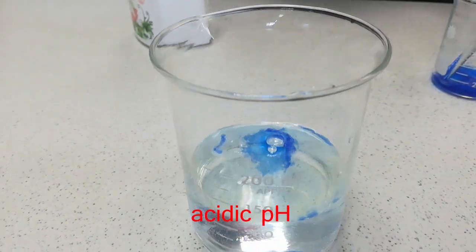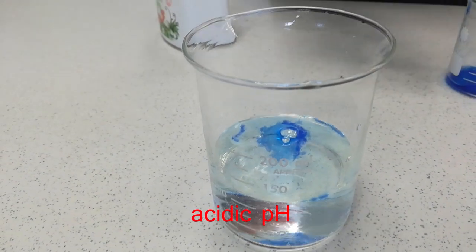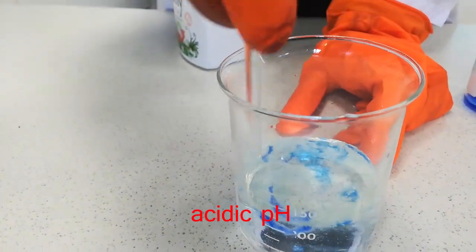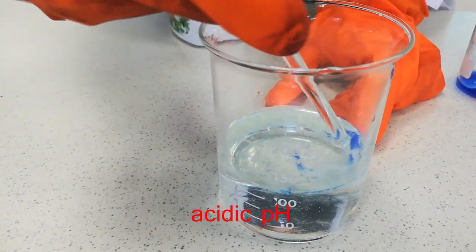This in turn is converted into insoluble rayon once the pH is reduced to the acidic value found in dilute sulfuric acid. Accordingly, rayon precipitates out when extruded into the acid.